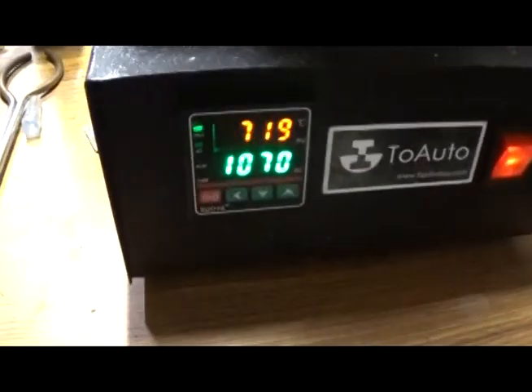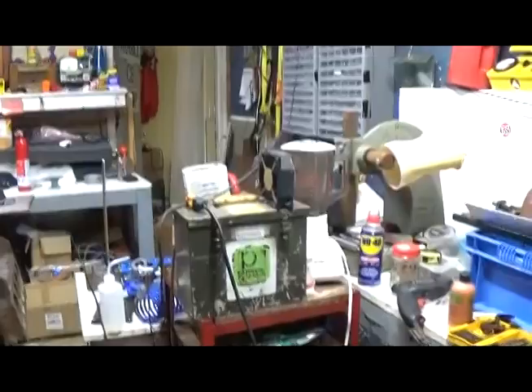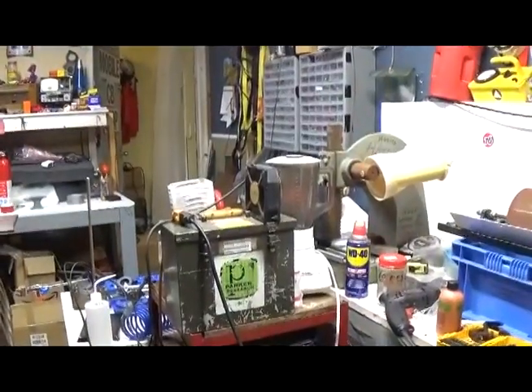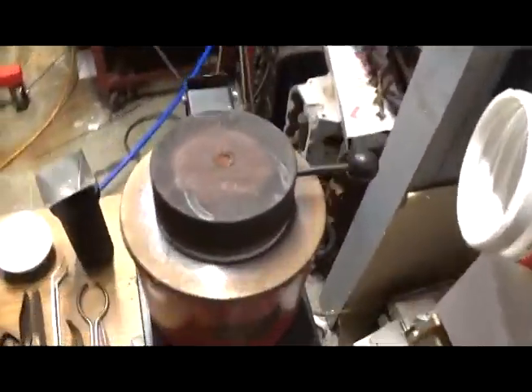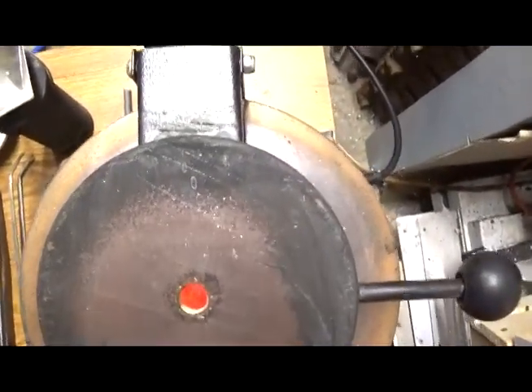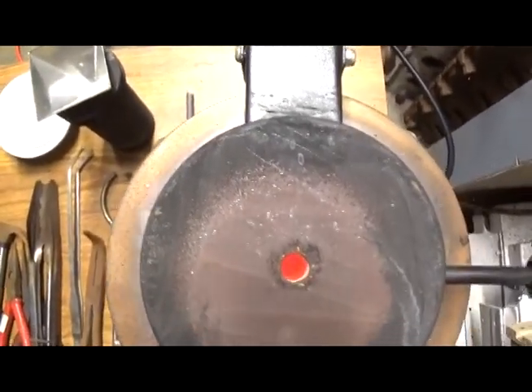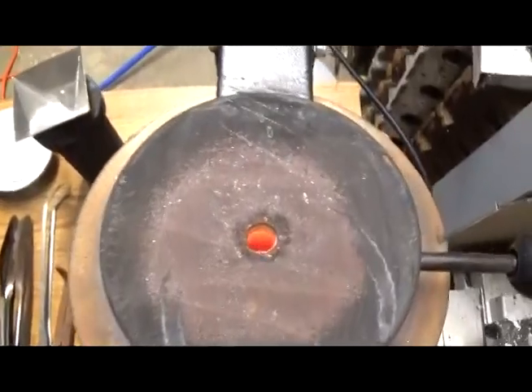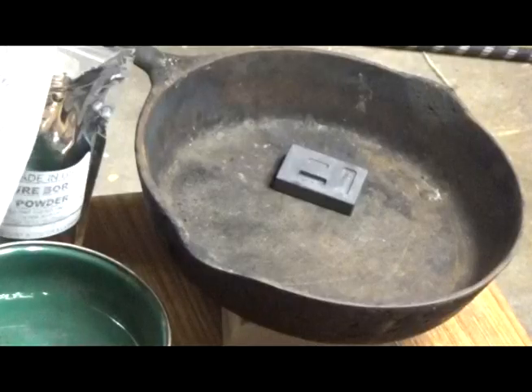All right, we're climbing nicely. Doing very well. Actually, very quickly. And that cord got really hot. I had to go get a fan to put on it. Used an extension cord like a moron. But yeah, you live and you learn. I don't think we're going to be able to pick up anything here for the heat. But you look down in there, it's getting there. It's getting there. So, about another 30 minutes.